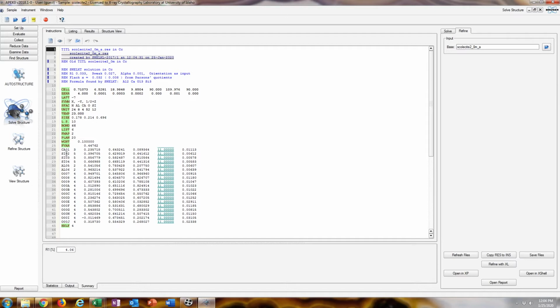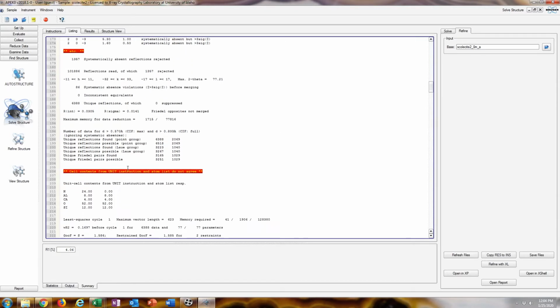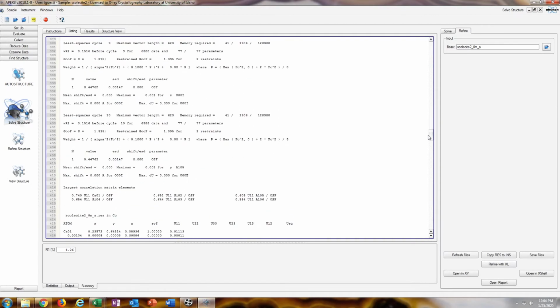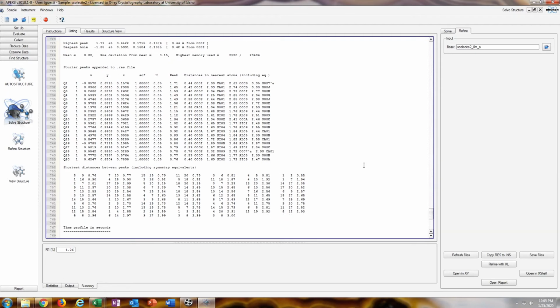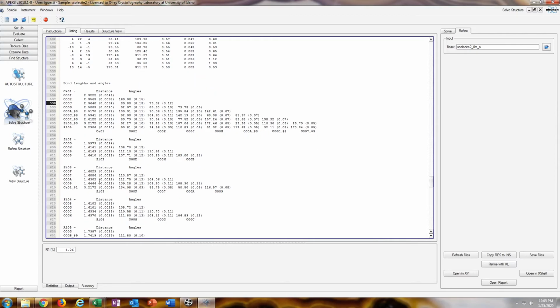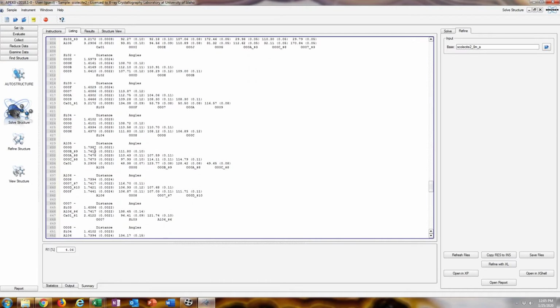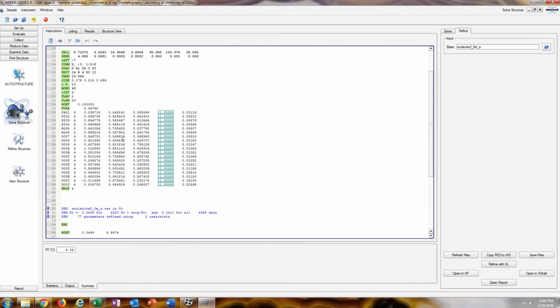And I'm going to check some of these bond distances in the list file just to make sure that they make sense. That's okay. Yeah, that's fine. Those warnings are nothing to worry about, really. But, okay, looking at the bond lengths up here, so we have Ca to oxygen, I, E, J, G. Those are all around 2.3, and then there's one that's 2.5. That's good. That makes sense. All the Si are about 1.6 angstroms from oxygens, so that works. The aluminum's 1.7. That all makes sense. So it really did find the correct atom assignments and everything in this example.